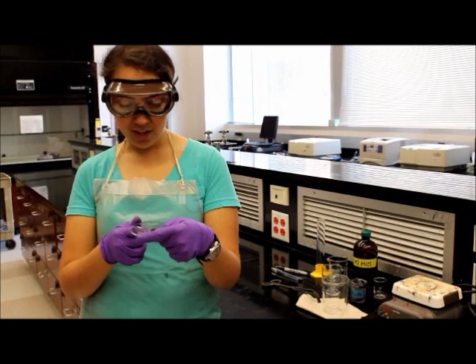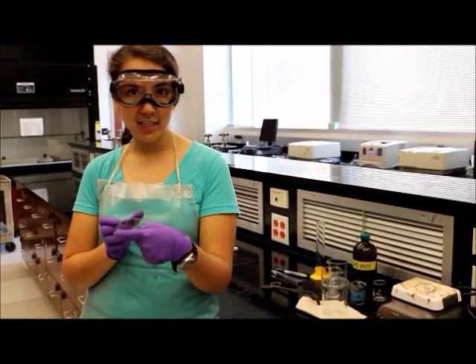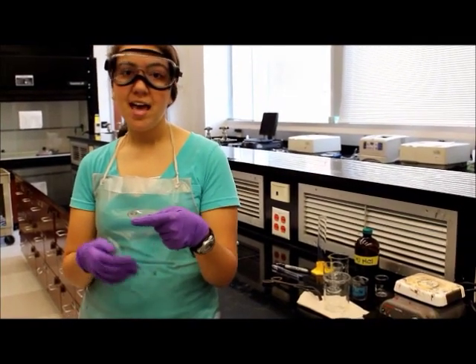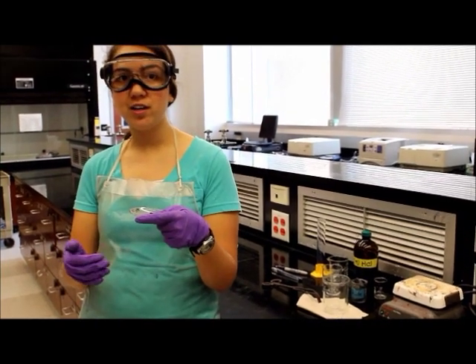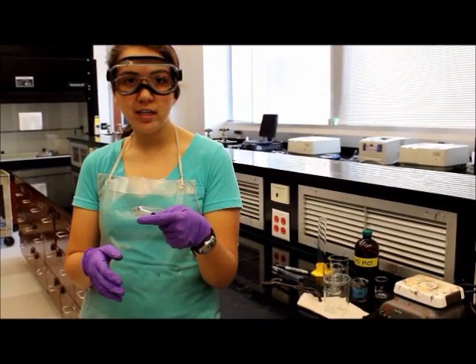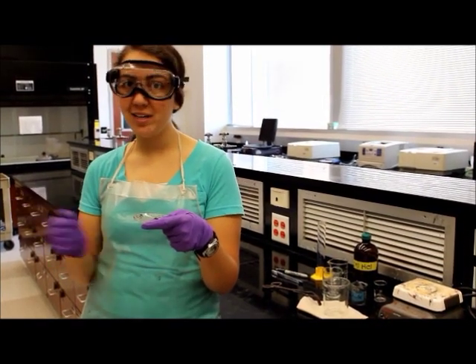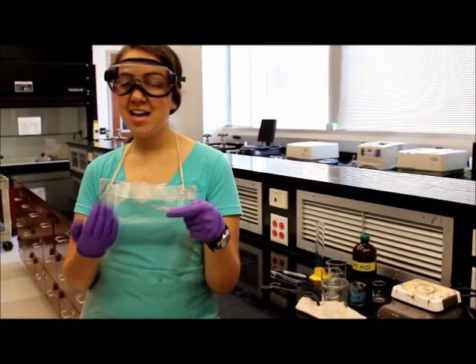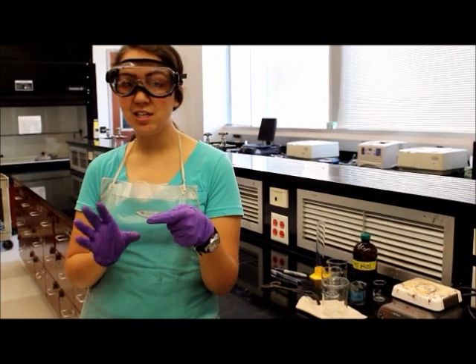Another thing is you don't want to over wash your precipitate before you put it on the watch glass because it will take longer to dry. And the drying time for this experiment is already going to be over the hour it states in your lab book because everyone is impatient to leave and will be opening the oven door and the heat will escape and it will take probably an hour and a half to two hours for it to completely dry.